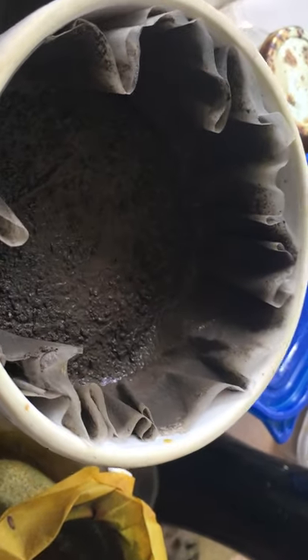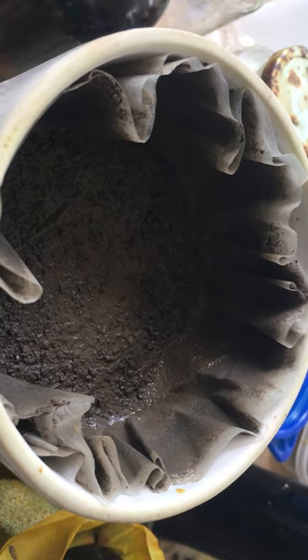So this is one of the operations from before with the zinc. And this is whatever is left from the zinc precipitation.